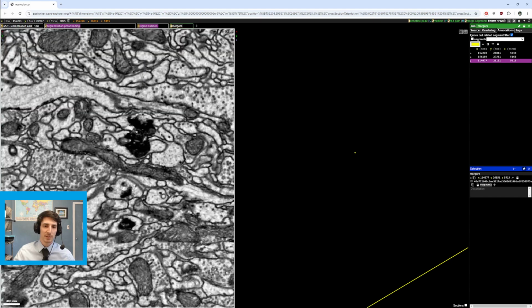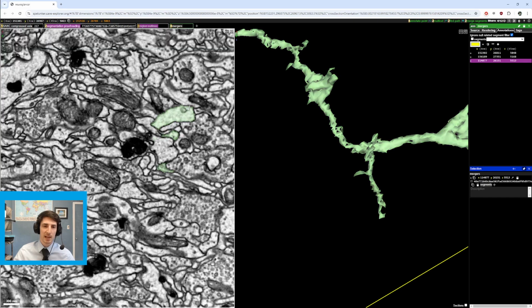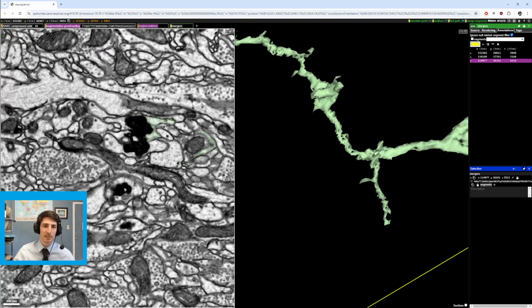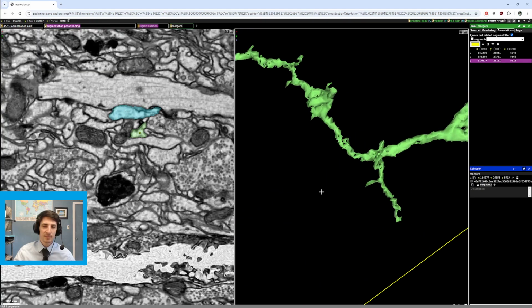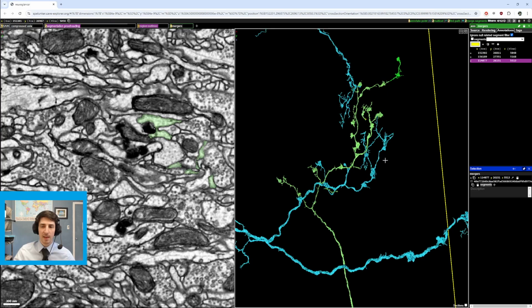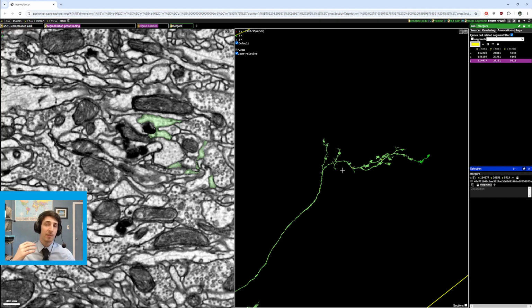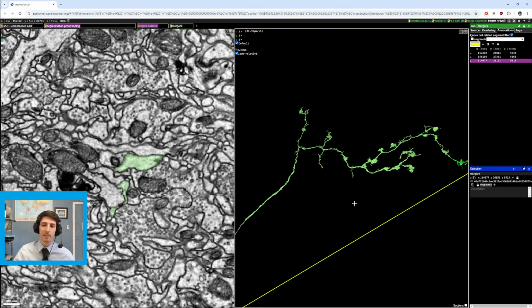It remains continuous on the right side of the membrane swirl. We come out on this side. But then what's this? This, nothing to do with us. So where did that come from? It turns out connects to this pretty nicely. Fits the shape of that branch as well. And there, even though we found some thin, smaller mergers, we were able to use the same context clues to locate a very large merger.